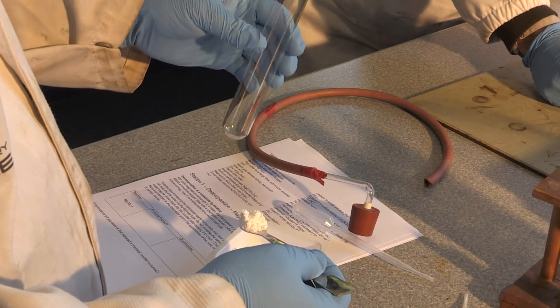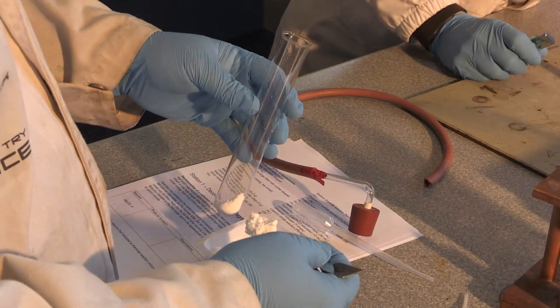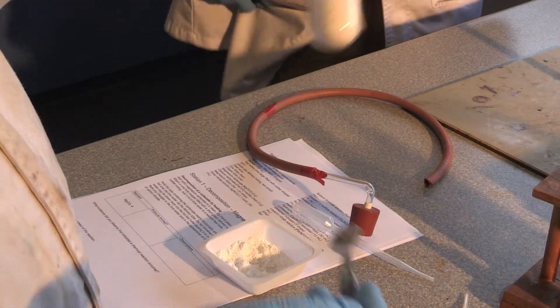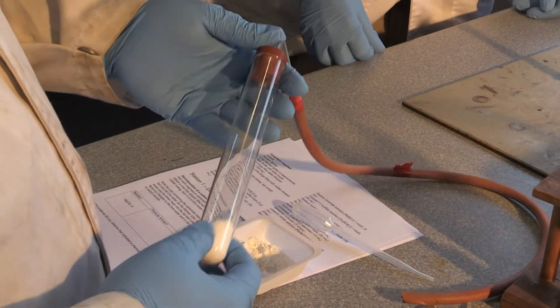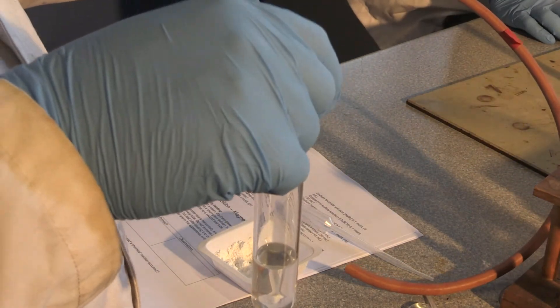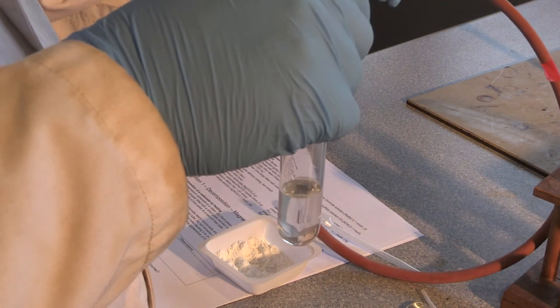Step one: add your solid magnesium carbonate into the test tube and put it over the Bunsen burner. We've got this special tube we've devised which will allow whatever gas comes off to flow into this test tube which is filled with limewater. Patrick, our ever wonderful lab tech, will be holding the test tube while I hold the limewater.